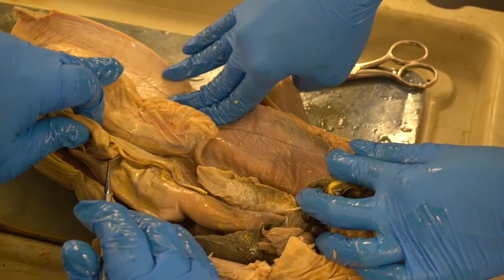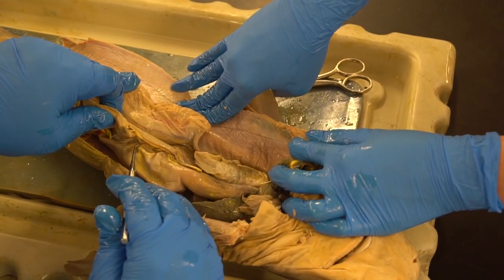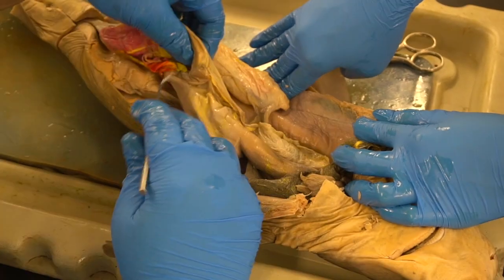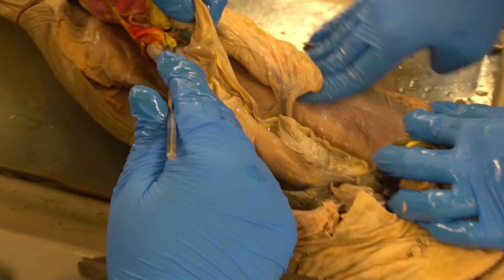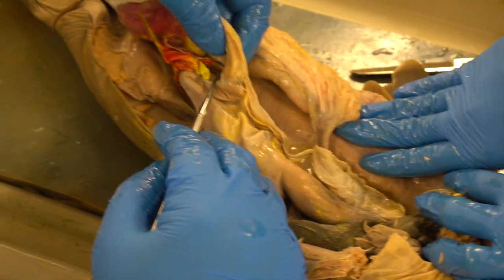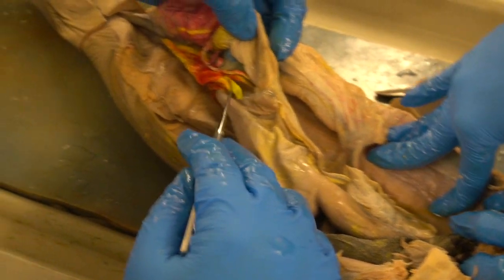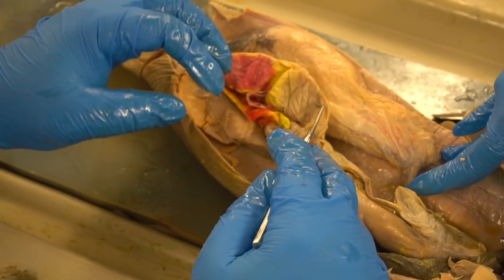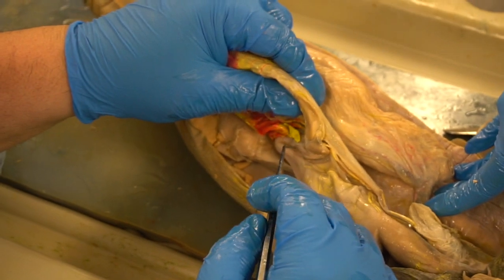All right. At the end of it, and the same thing with our stomach. What does our stomach dump into? What's the next organ in line after our stomach? Intestines. Our intestines, and it would be the small intestine first. So at the end of the stomach, there is a valve that prohibits flow into the intestine. Okay, we call that the Pyloric Valve. We have a similar thing in our system, and it leads into this little curve of intestine here, which is called the duodenum. Sometimes you'll hear it pronounced differently, but the correct pronunciation is duodenum.